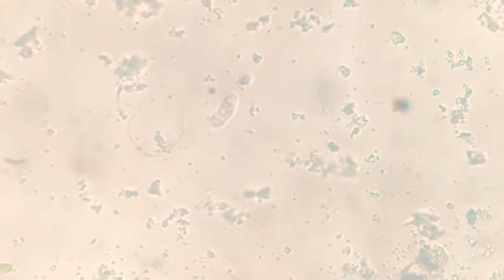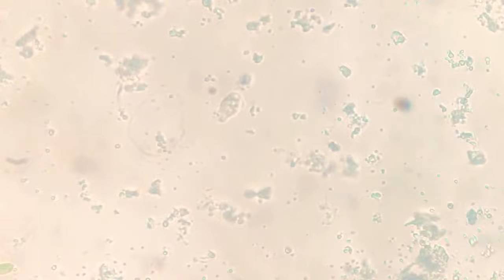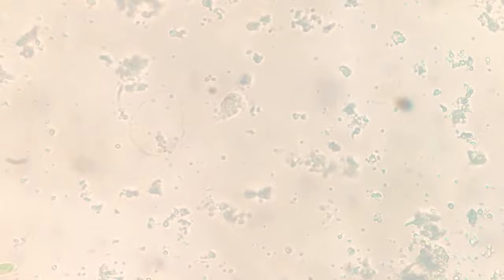Here in the center is the amoeba. But I'm not able to get a good picture. This is the amoeba that I was trying to trace and introduce to you. All through my life, I had not seen an amoeba prior to this, but now suddenly they seem to be raining from everywhere.